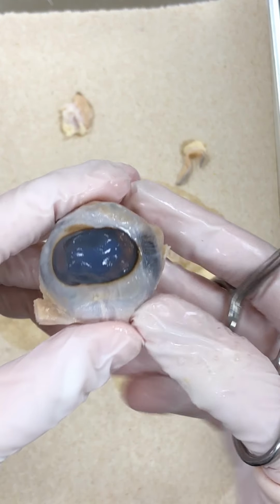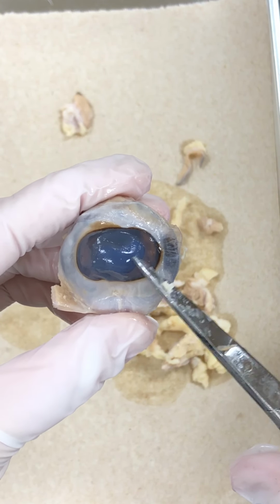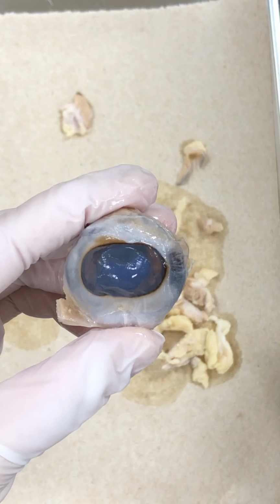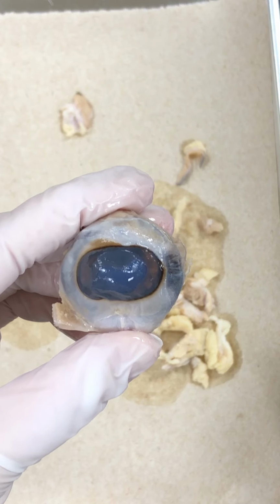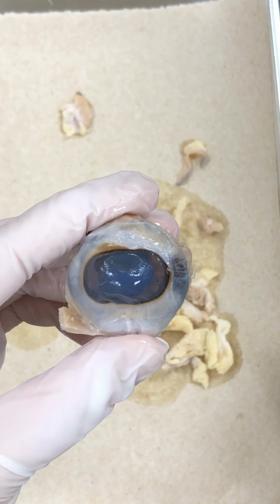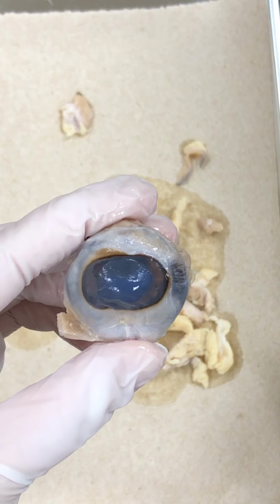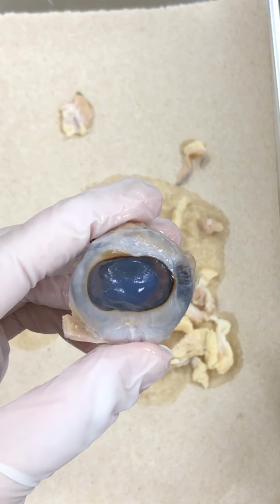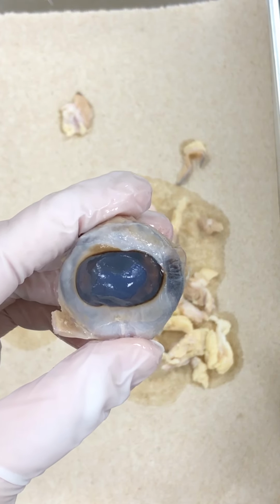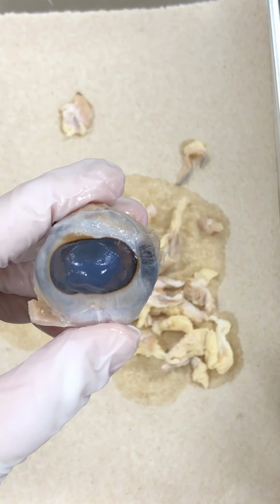Okay, anteriorly, we have the cornea. Very clear. Well, it's not so much clear in the preserved specimen. A lot of times the preservative fluid causes the once clear cornea to cloud up a little bit. Also lack of oxygen. The organism is no longer living, and so lack of oxygen causes that cornea to cloud up. We know that in living specimens such as us or sheep, it's very clear, very transparent. You can see through it very easily.